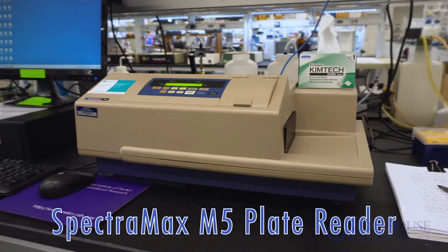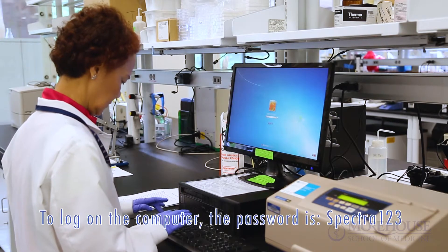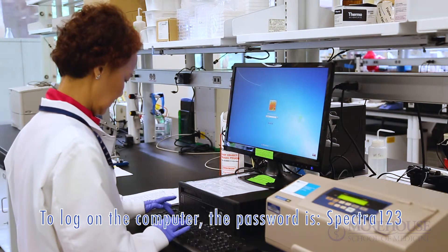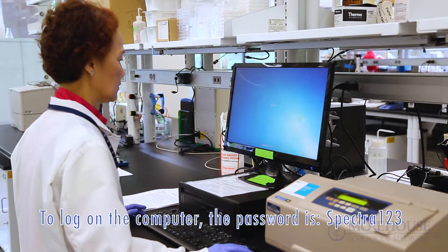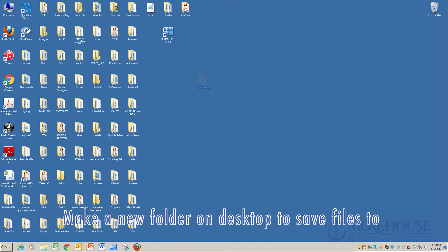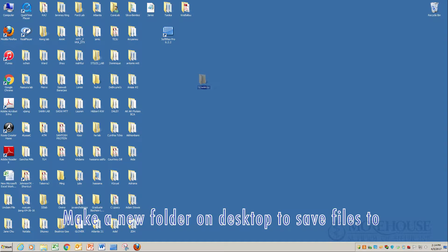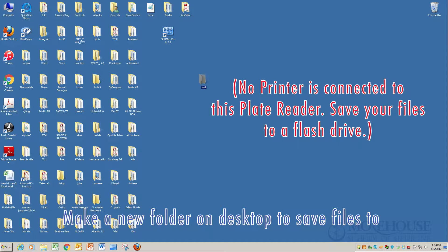Spectra Max M5 plate reader. To log on the computer, the password is spectra123. Make a folder on the desktop to save all your files. No printer is connected to this plate reader, so save your file to a flash drive.